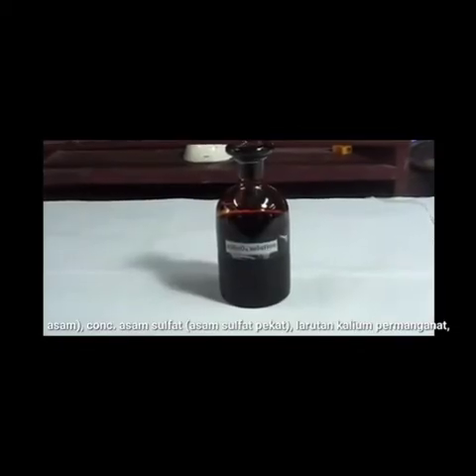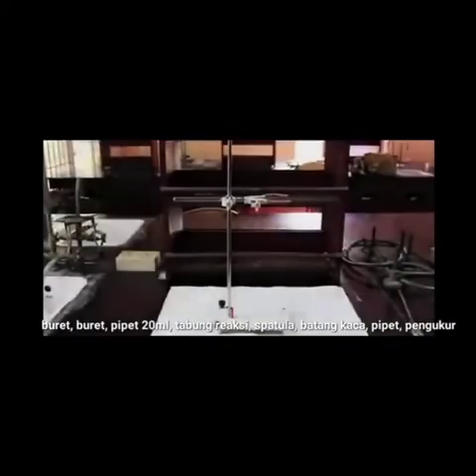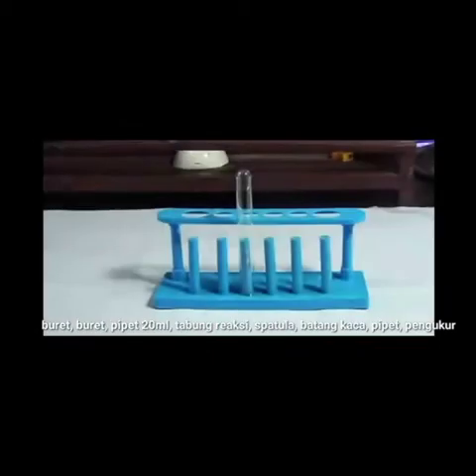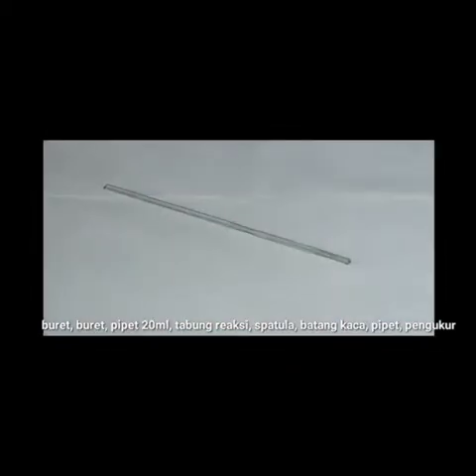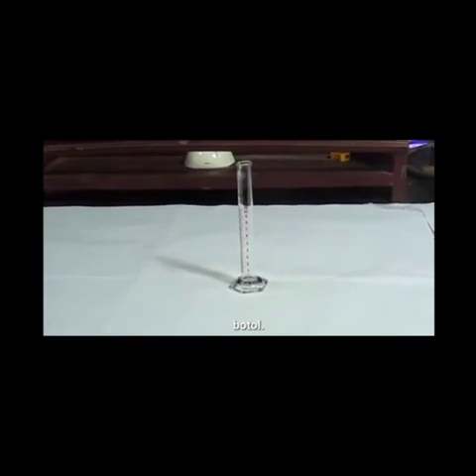potassium permanganate solution, burette, burette stand, 20 ml pipette, test tube, spatula, glass rod, dropper, measuring jar.